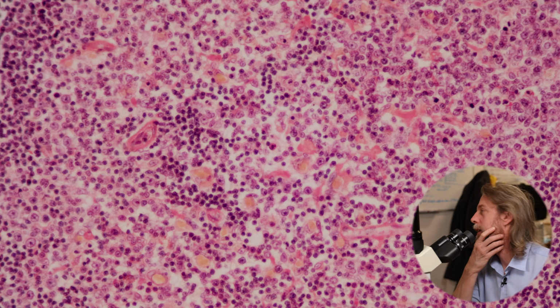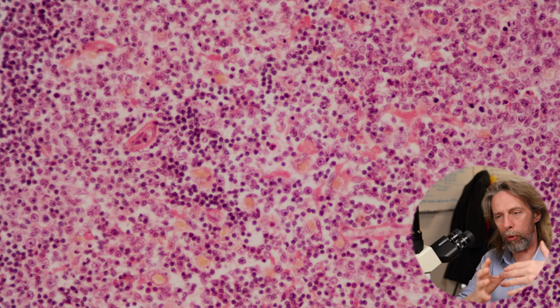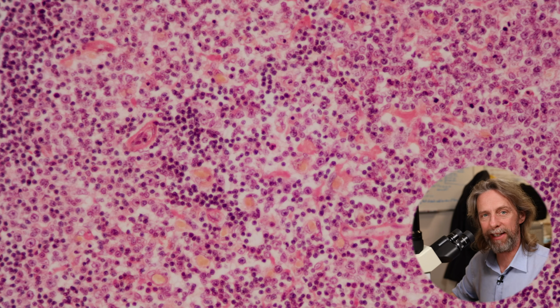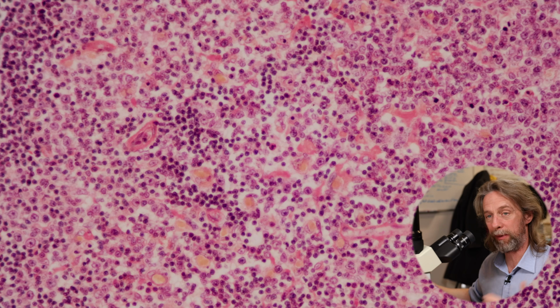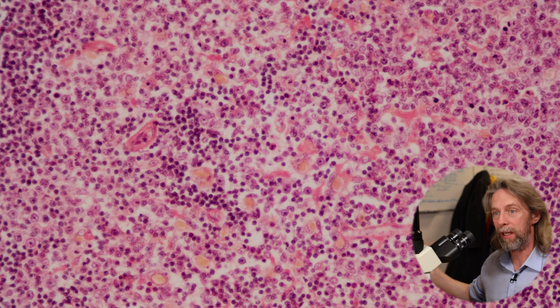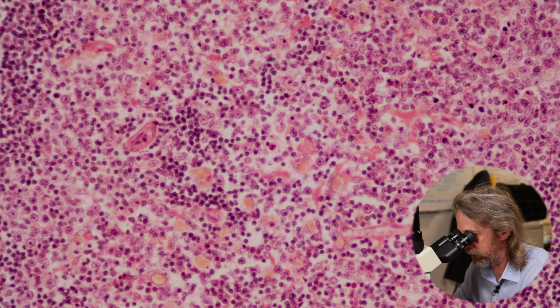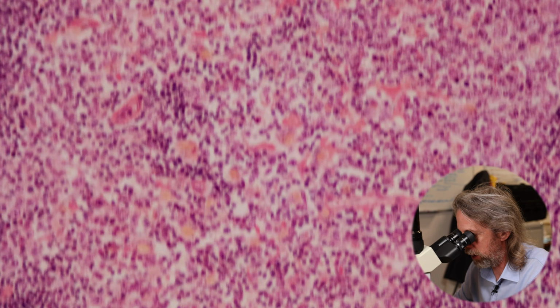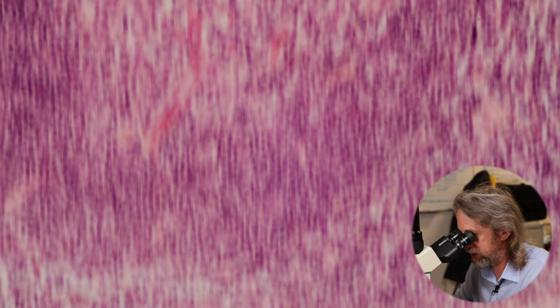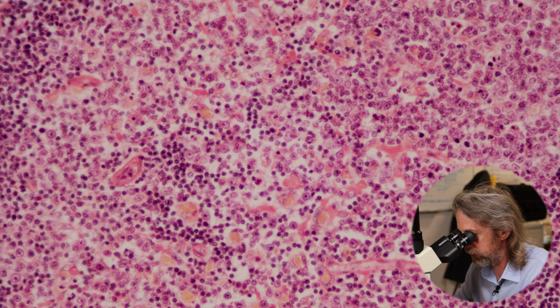So B cells will recognize a specific antigen on the surface of an invading pathogen, and they might have a specific antibody in their memory, which is the adaptive immune system, right? This is how you can then adapt very rapidly to a known pathogen, a pathogen that your body knows. So yeah, we've got B cells proliferating and differentiating in the centre there to become plasma cells, to chuck out loads of antibodies to fight against an infection.